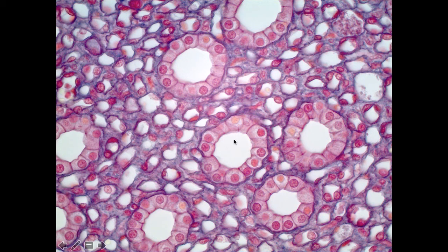We can see about 7 or so tubes or ducts, and the kidney itself is made up of millions of these ducts. In certain stretches, they have these beautiful simple cuboidal ET linings. I think this is one of the nicest examples of the simple cuboidal. The shape of the cell is absolutely cuboidal. It's not, as we'll see, thin.